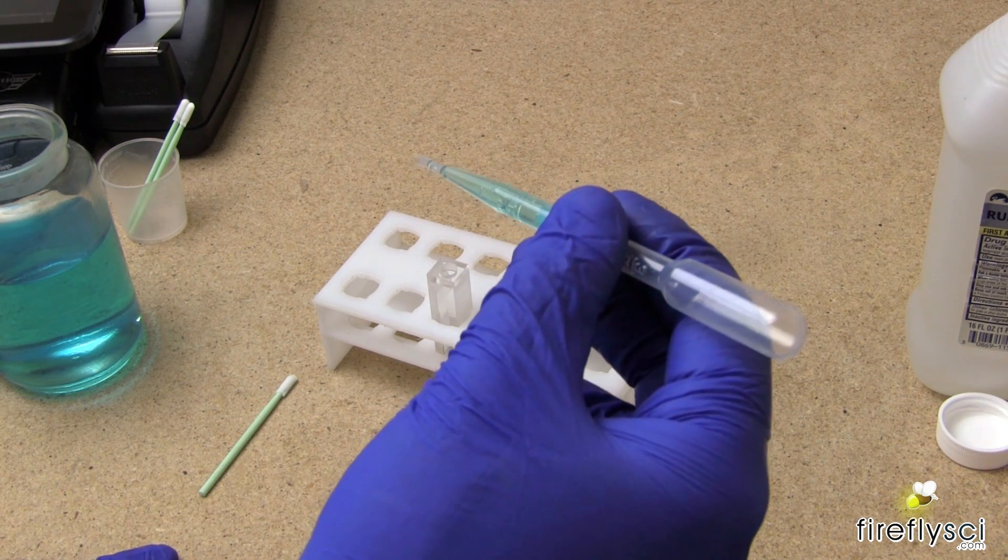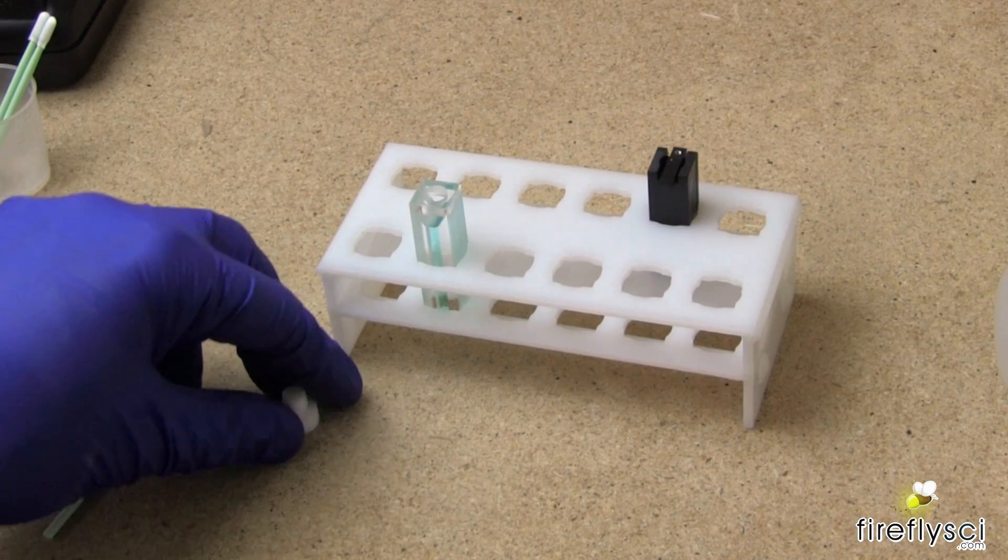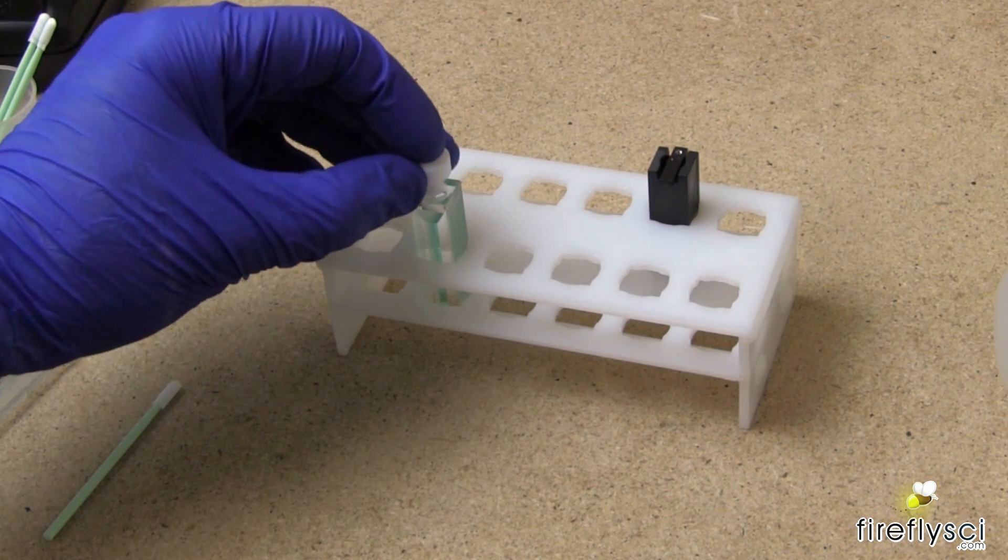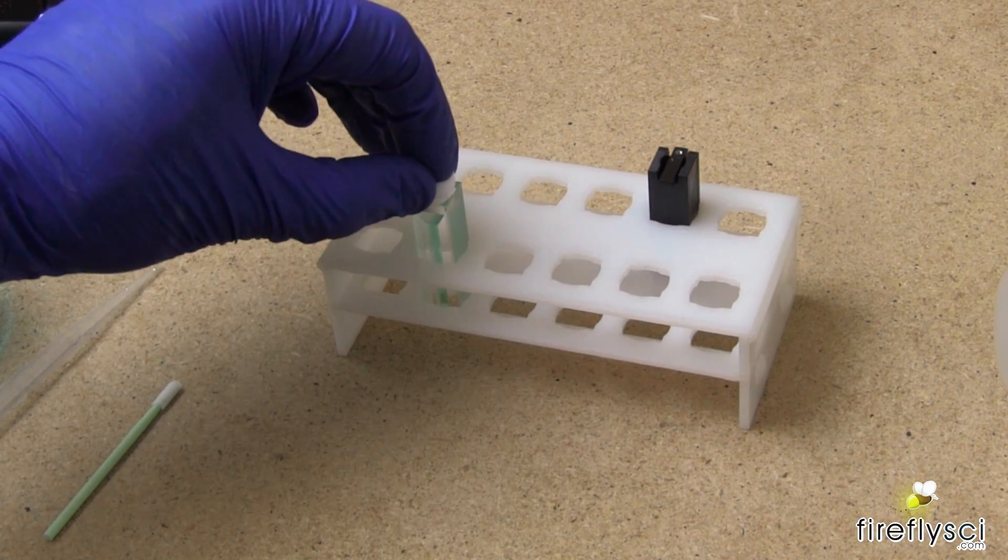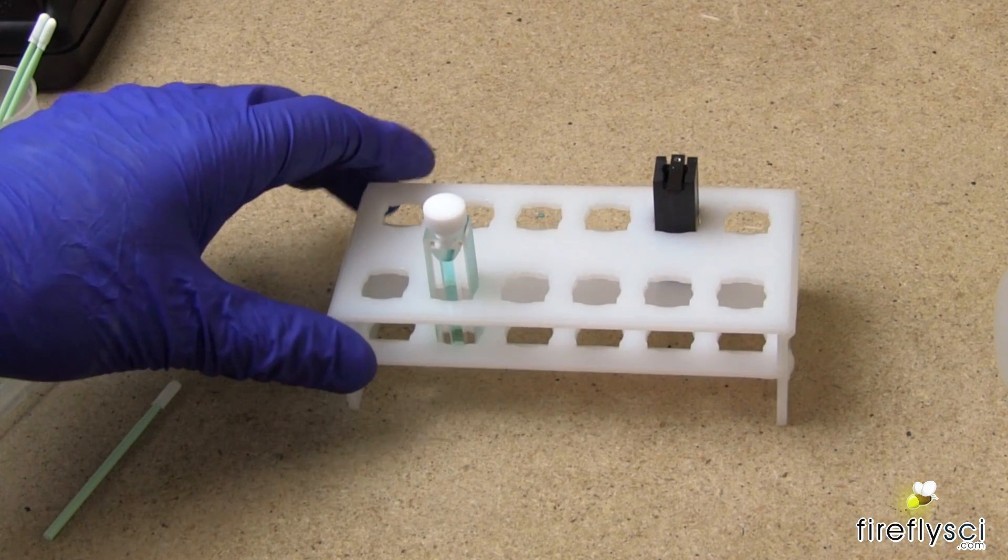Now I'll inject some of our sample into an empty cuvette. Once the cuvette is filled up, you can put either the cap or we have a stopper in this case on the cuvette to make sure that none of that sample gets out.